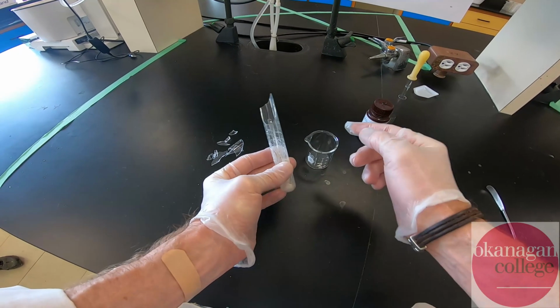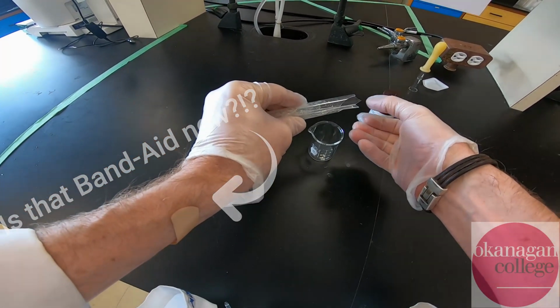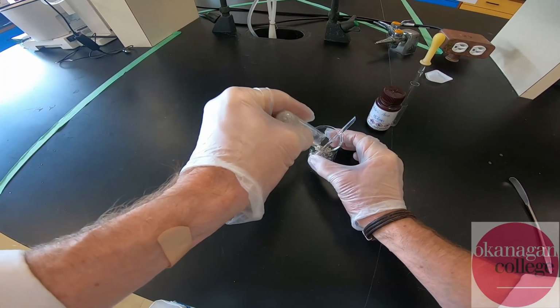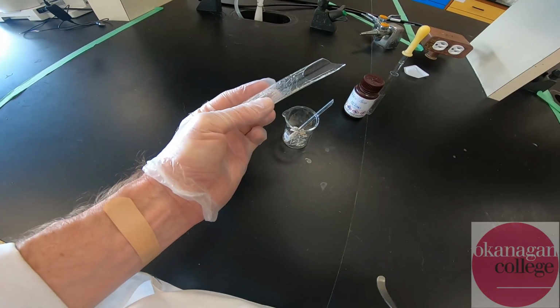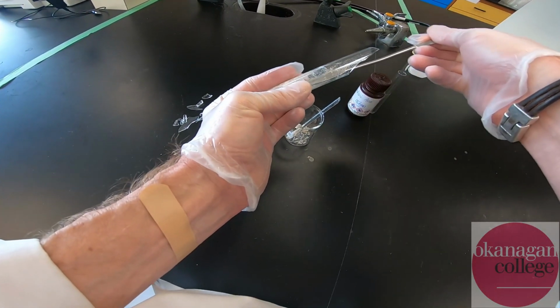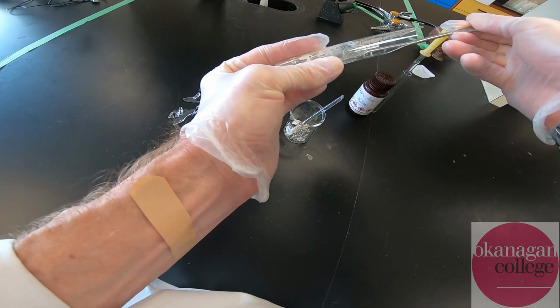So I'm going to transfer this material in here. Okay, so the best we can do, you can see we have a solid plug of material here. We do have some glass shards there. That's going to be fine. I'm going to transfer that in a few moments to a secondary container, but clearly this test tube is past its best before date, and I am going to now transfer the last little bit of material.